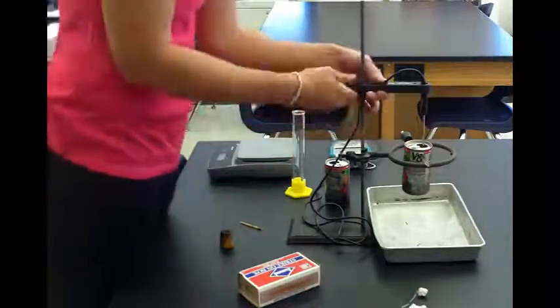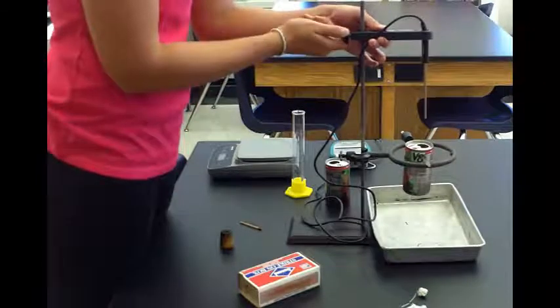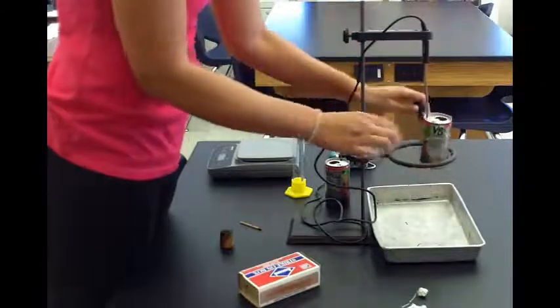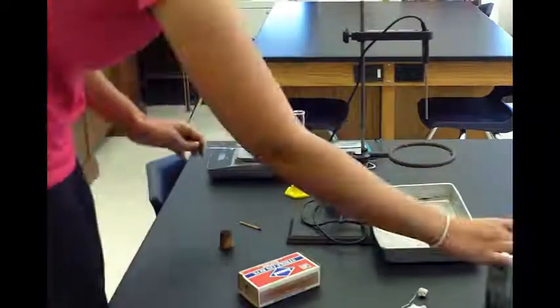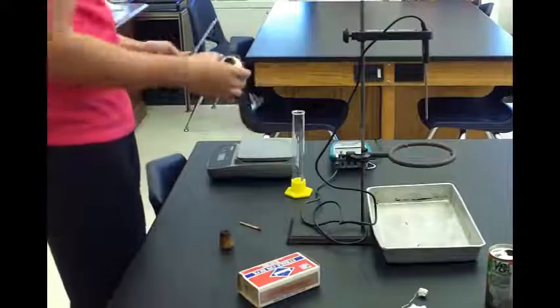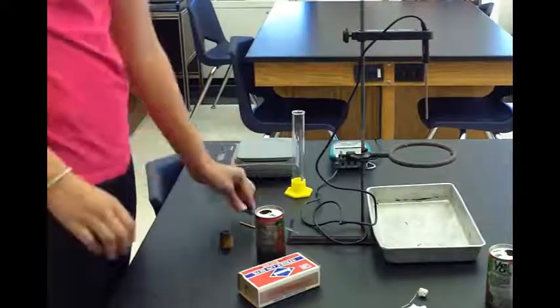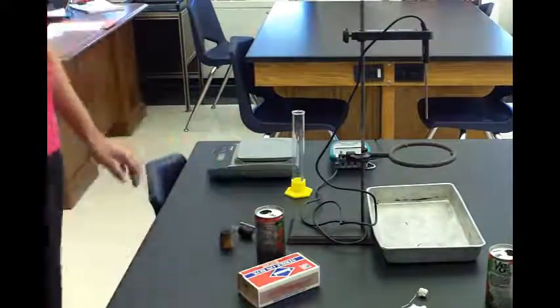The last step you need to do is undo the probe and take off the can. Be careful—it might be warm. Do not use this can again; that's why we have a second can. Then just repeat the steps.